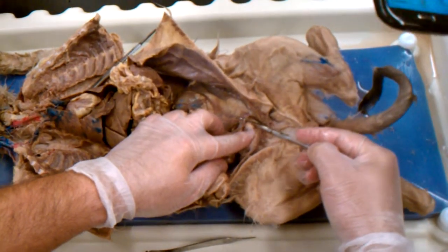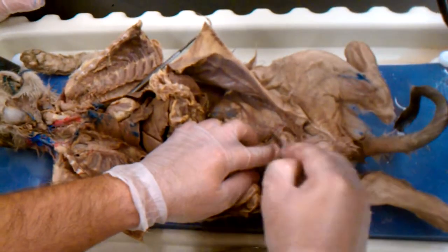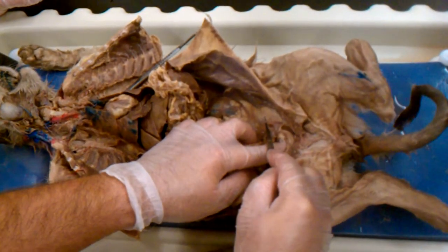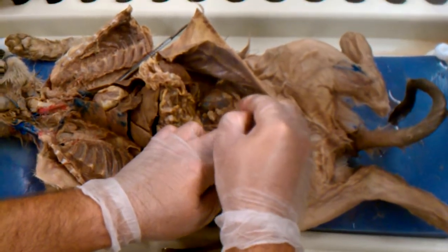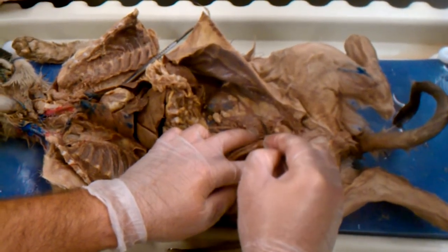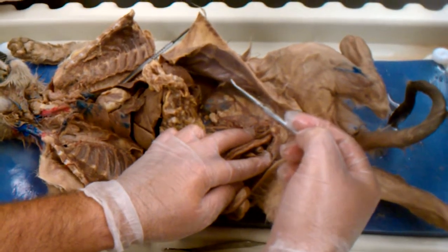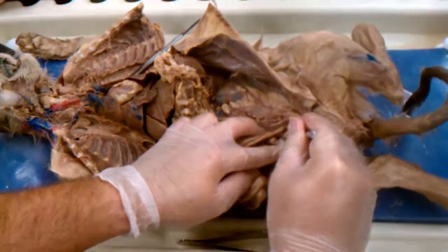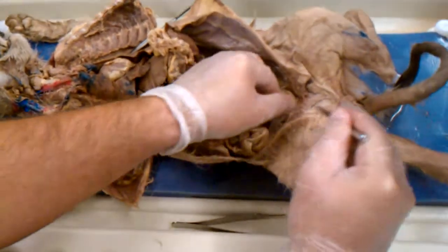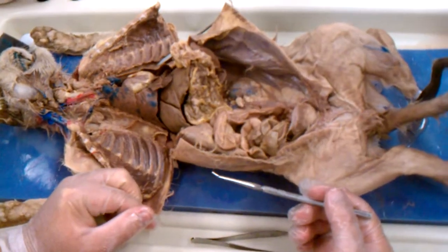If it was a female cat, underneath here would be the ovaries with the ovarian ligament and the fallopian tubes, which we're not calling fallopian tubes, we're calling them uterine horns in the cat. And the uterus would be underneath the bladder. The bladder would be right here. And that's really all there is in reproduction, except for we're going to open the scrotal sac to actually expose the epididymis.